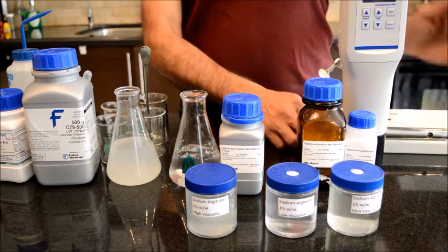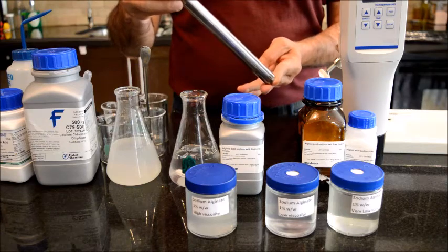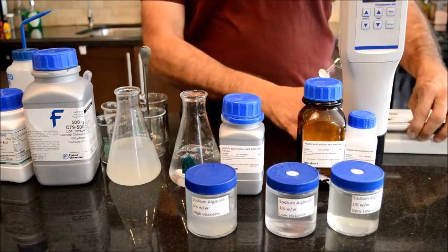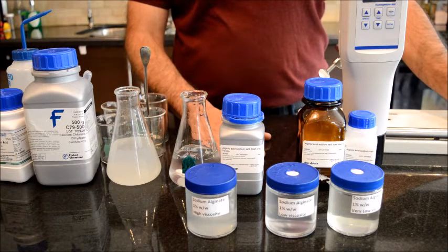These homogenizers are not cheap, and just this blade itself is more than $1,000, maybe a lot more. But on the other hand, the high shear mixer that you can buy at your store near your home is probably less than $100 or $50 or whatever it is. So you could use that equipment as well.